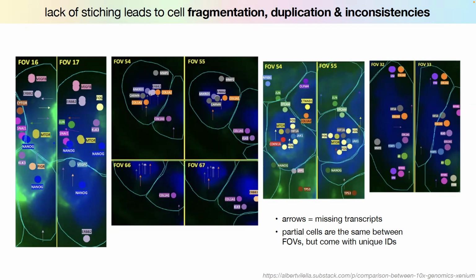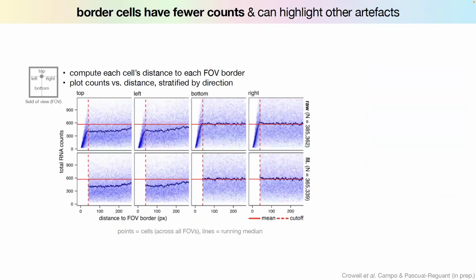So one thing that I did in the previous data set is shown here. We can quantify the distance of every cell to the border. So if this is a cell, how far is it to the top, to the right, to the bottom, to the left? And we can plot that against the counts, and we see that very close to the borders, there's this drop. The cells are cut in half. And then what I did in the previous plot is I say, okay, if it's closer than 30 pixels, I remove it. 30 pixels, I mean, that's really tiny. It's like a third or a fourth of an actual cell diameter. So it has to be really close to the border for me to remove it.